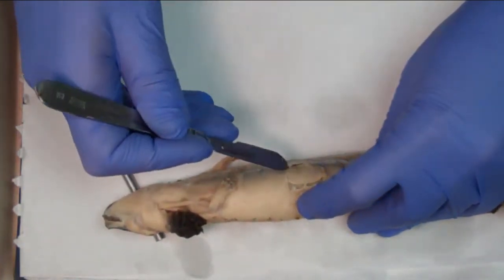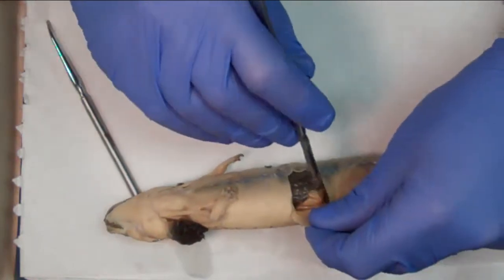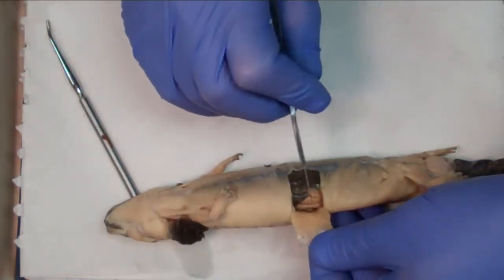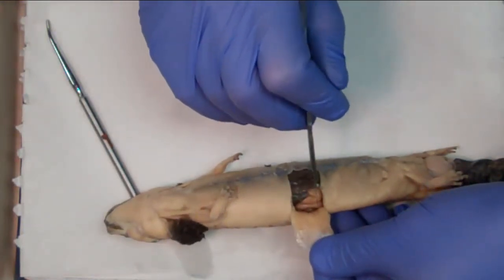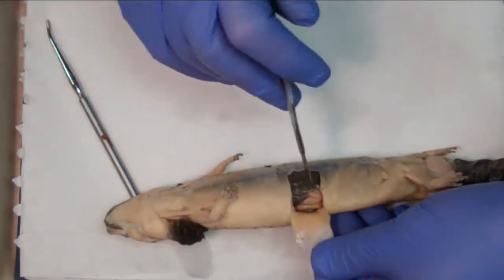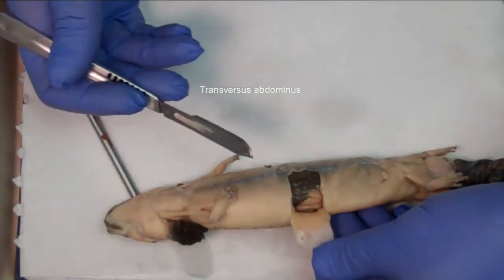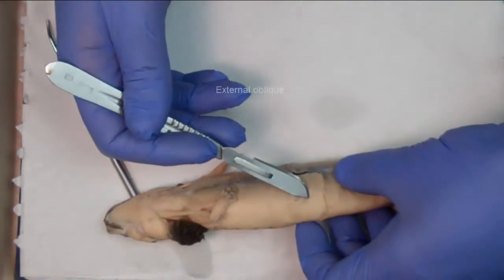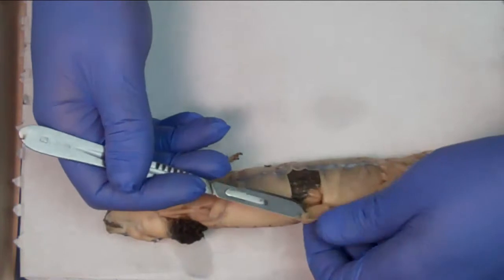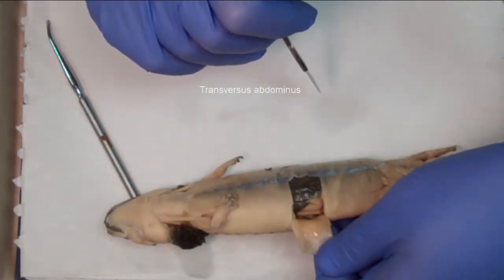Right here. And once I open and get on the inside of the mud puppy, it's going to be difficult to see the details of that, the grain of that in the video, but I'll exaggerate the fibers for you. So the fibers are moving essentially perpendicular to the midline of the body. So that's going to be your transverse abdominis, or transversus abdominis. So I'll repeat. External, internal obliques. You go one level inside, and the fibers inside are the transversus abdominis.